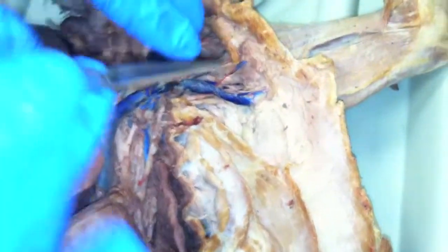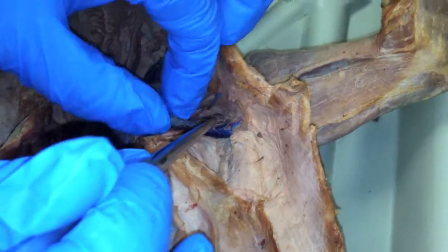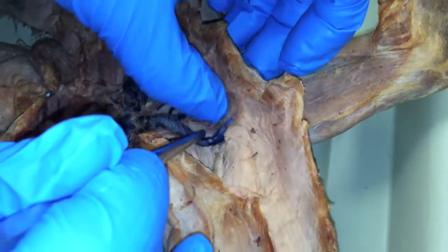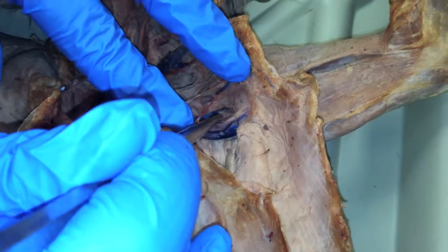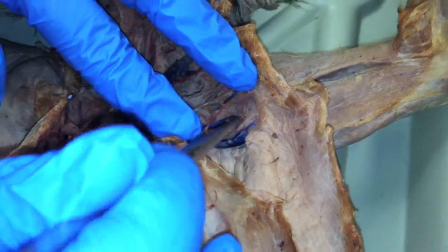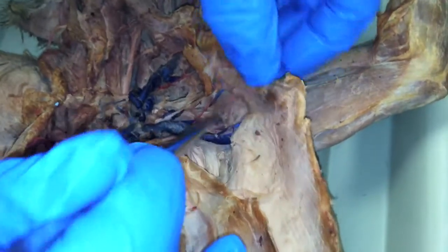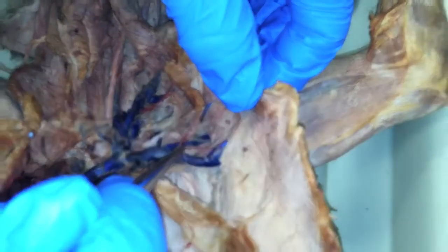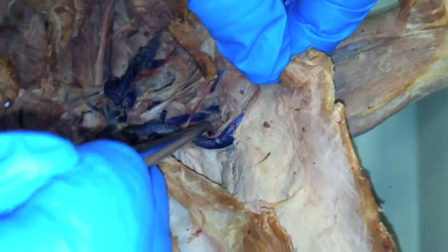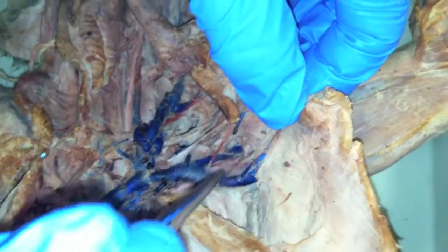It's going through the... and brachial is after that? Brachial after your subscapular branches off. Further along in here. This looks like your long thoracic there, right? Can you say the long ventral again? Long? That one right there.